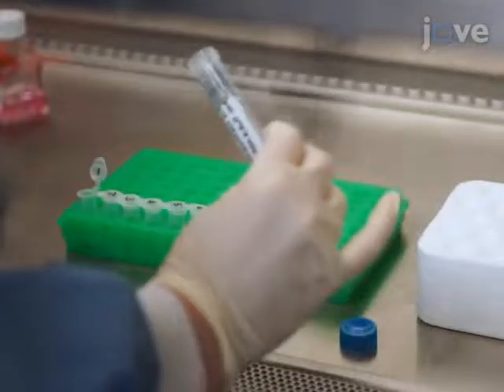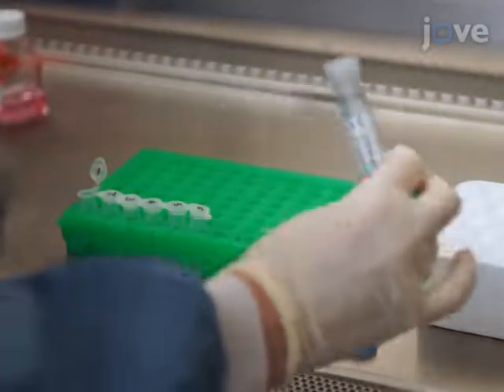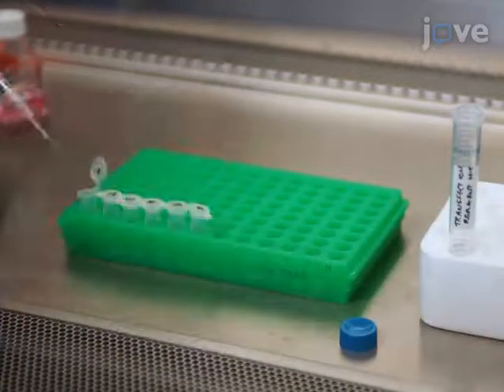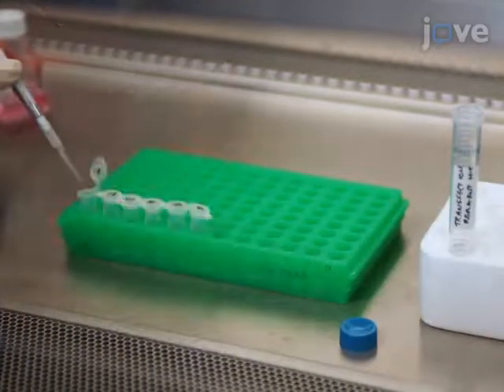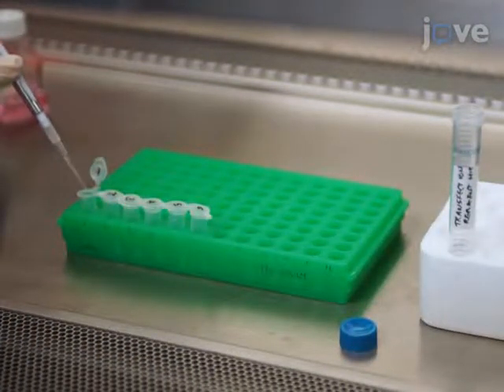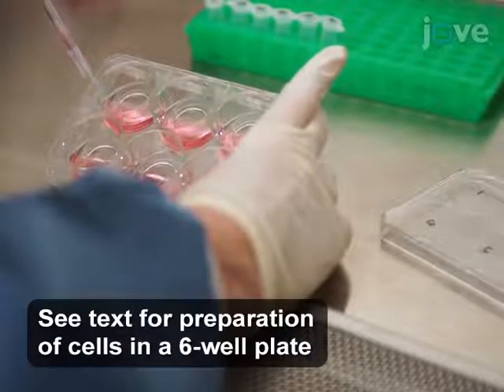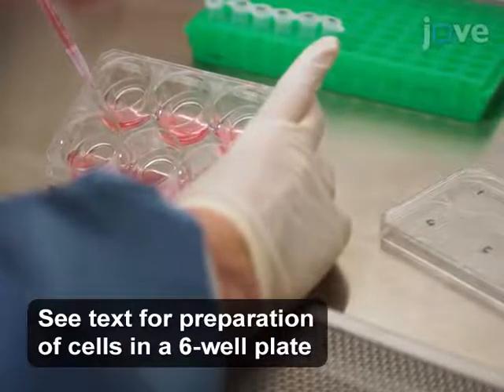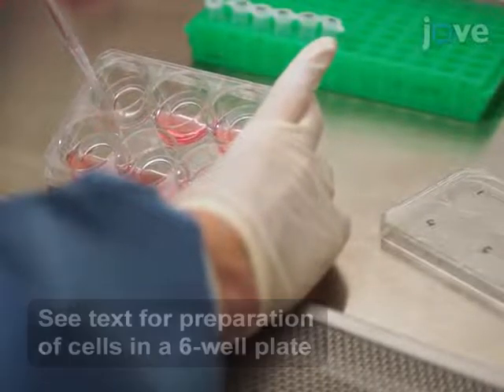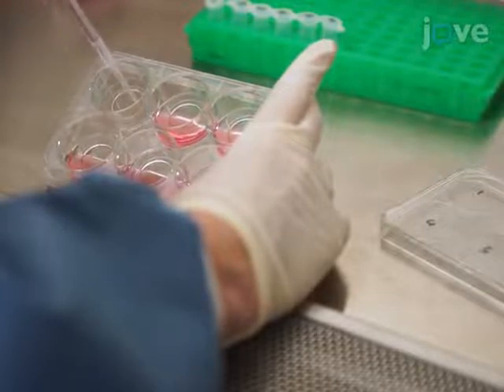Bring each tube up to a total volume of 100 microliters by adding reduced serum media. Using a P200 pipette, add 100 microliters of transfection reagent solution to the plasmid mixture in a dropwise manner. After incubating the plasmid transfection reagent mix for 20 minutes at room temperature, aspirate the media from the cells using a pipette or with suction.